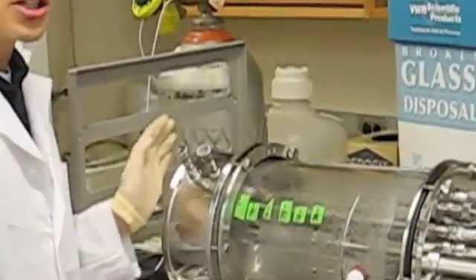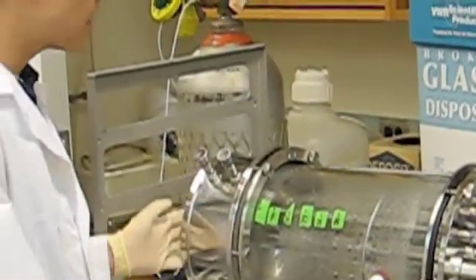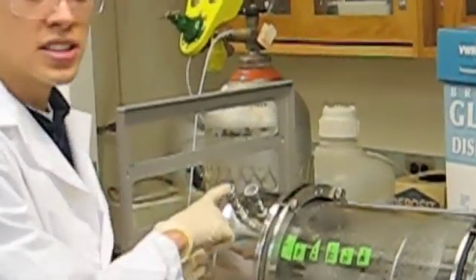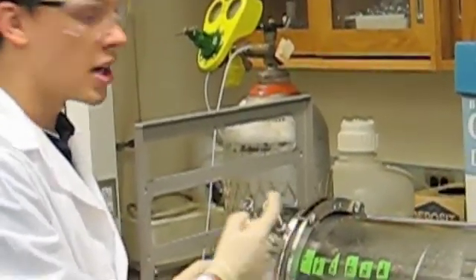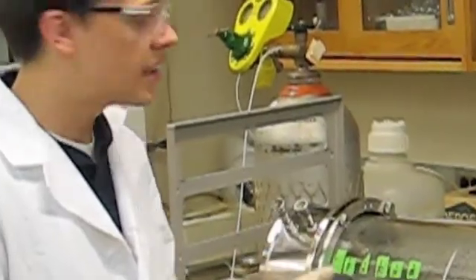Starting at the bottom, you can see our heating jacket, which is in the bottom, and then this is our water jacket in and water jacket out for it, and warm water runs through this and heats up the whole vessel.